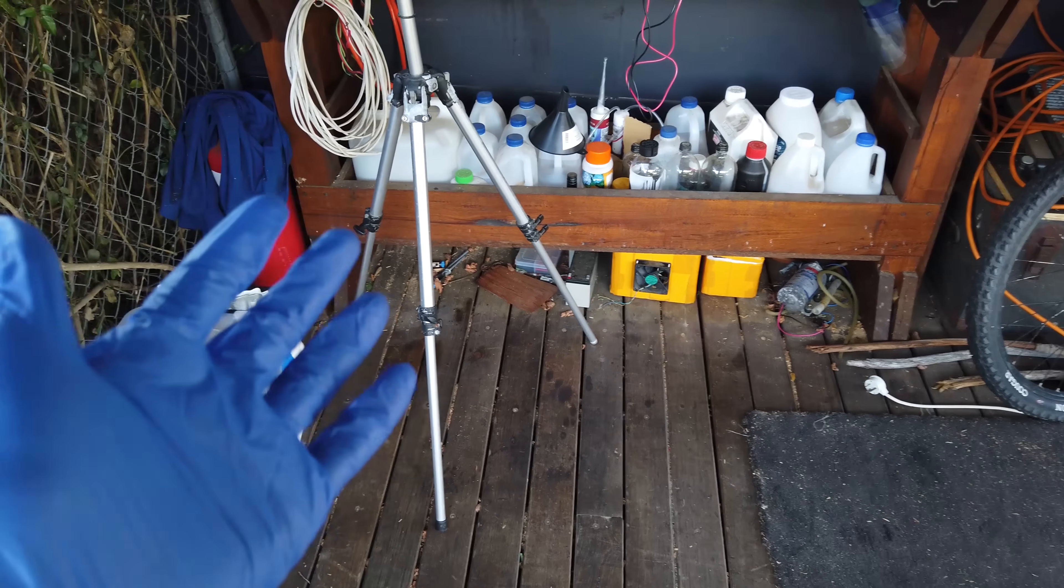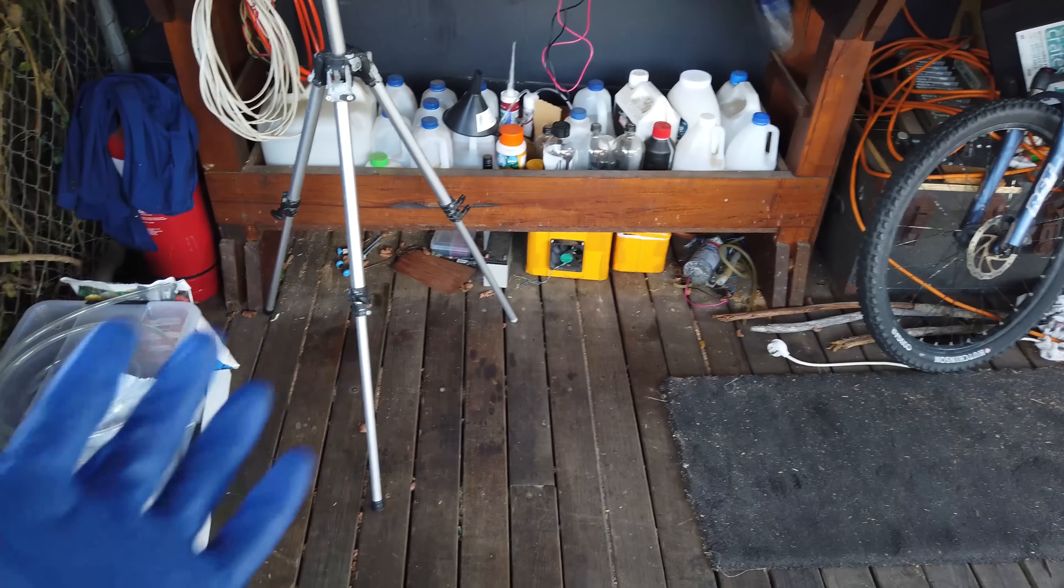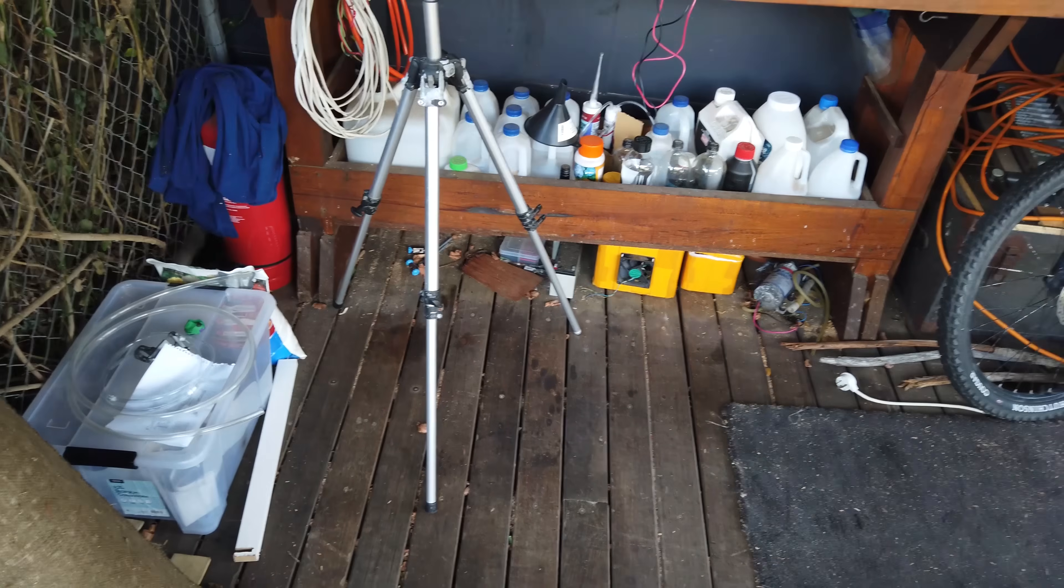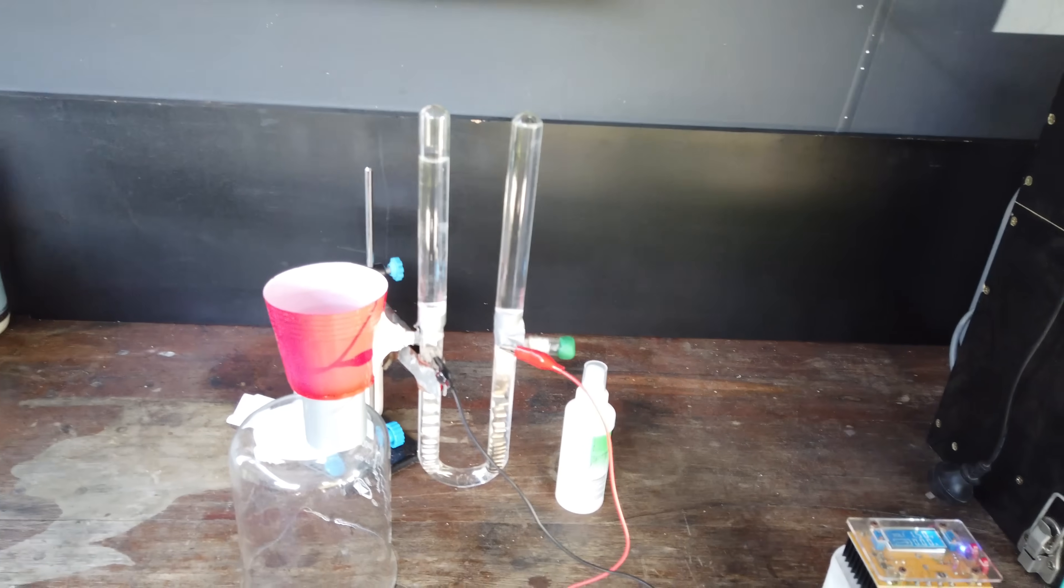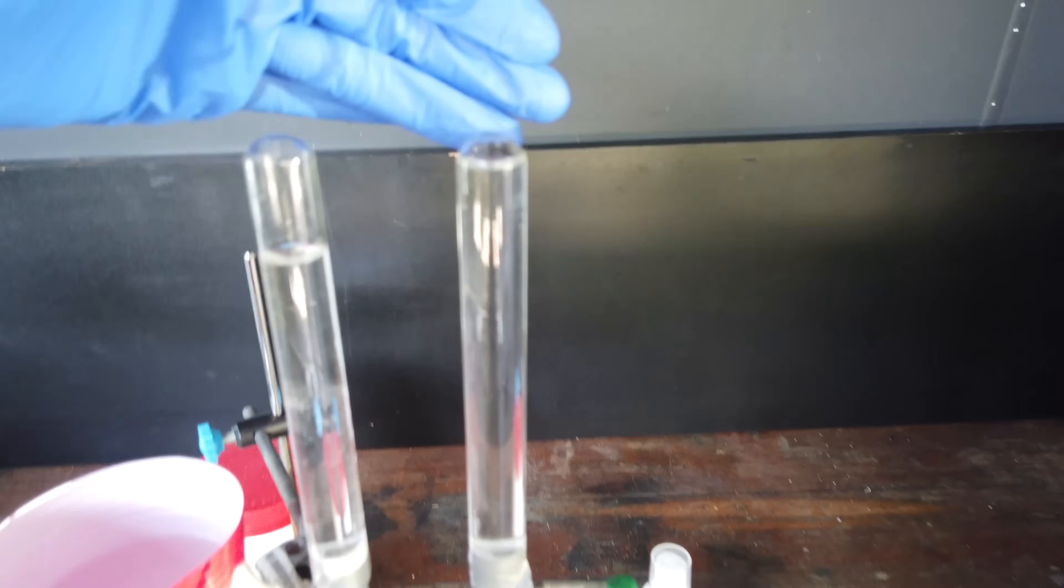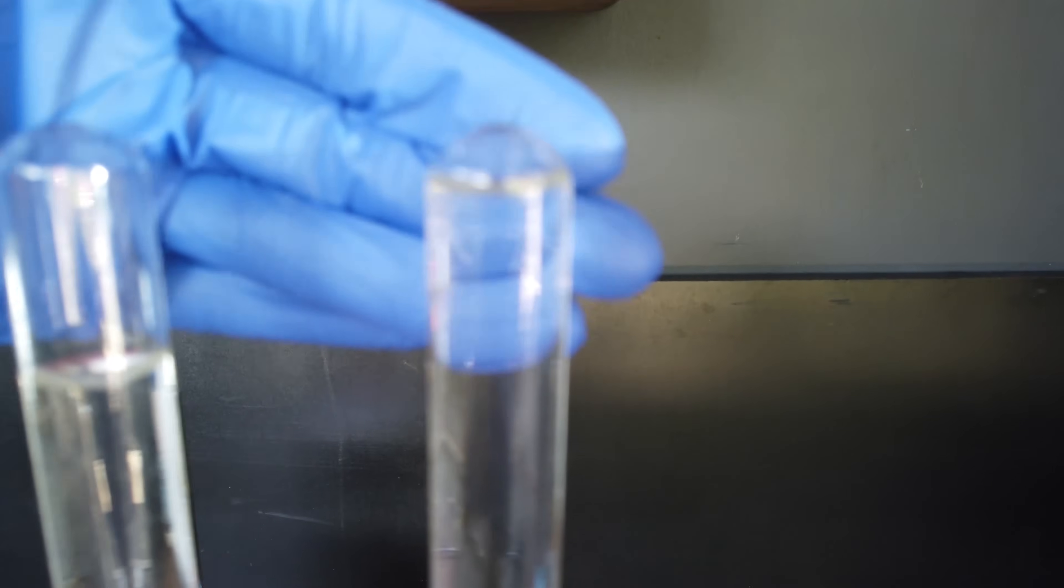At the start of this video, did I say that this was going to be a simple experiment and like an easy process? Because that was a really stupid thing to say. If we have a look here, I've been running this electrolysis for 24 hours now. And look at all of this nitrogen that we have produced.